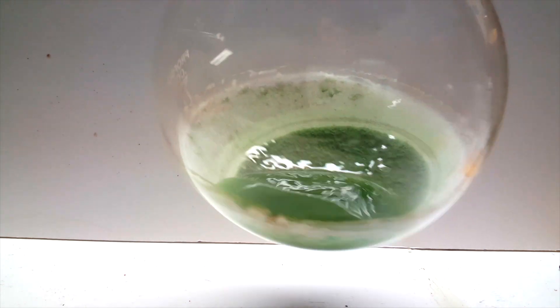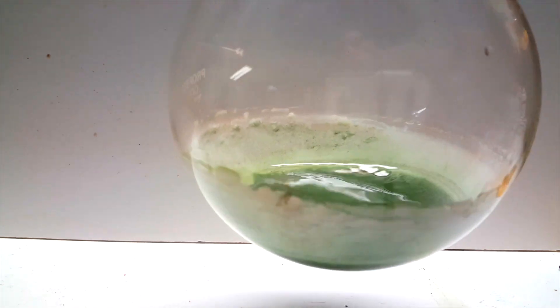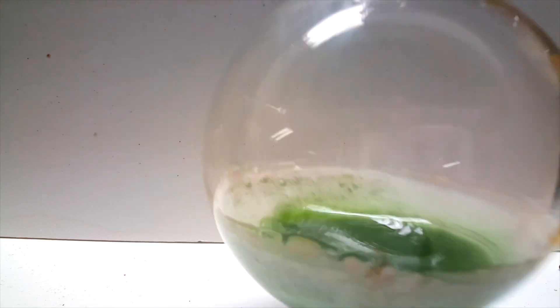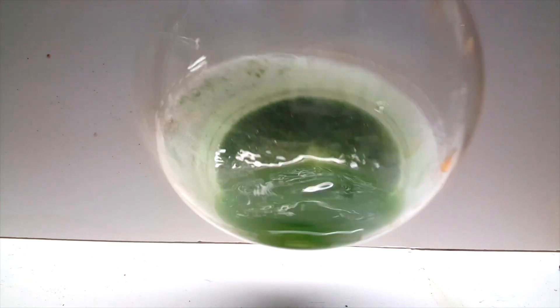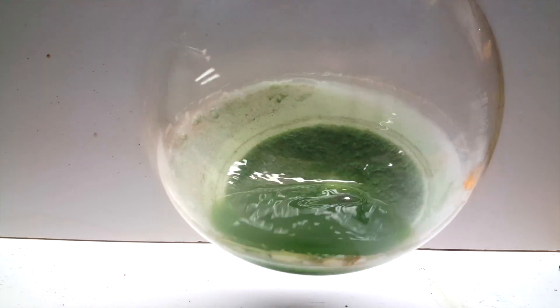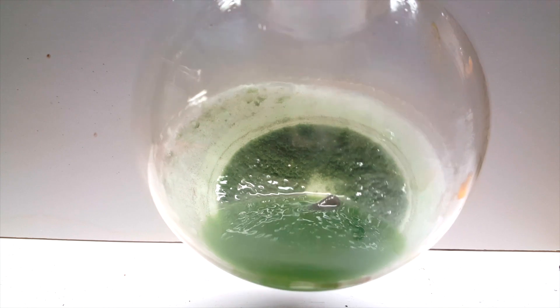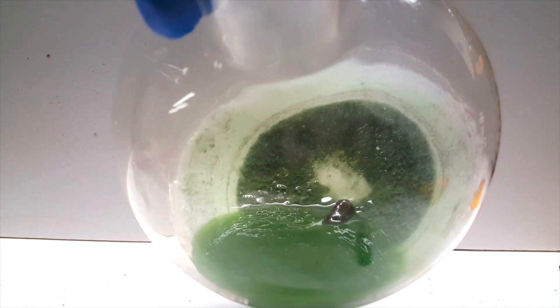Here's what's left over from the distilling flask. It contains a viscous liquid of phosphoric acid in what looks like the original chromium compound. You can see again that the stir bar was completely degraded and is now black, and there's plenty of junk stuck to the side of the round bottom. I may try to extract the chromium from this in the future.